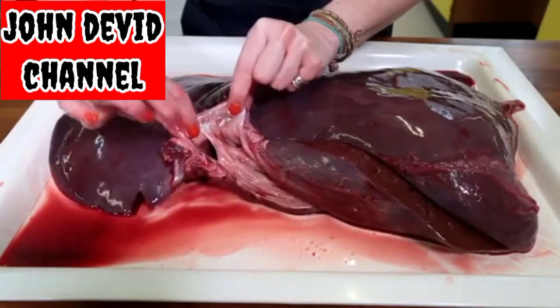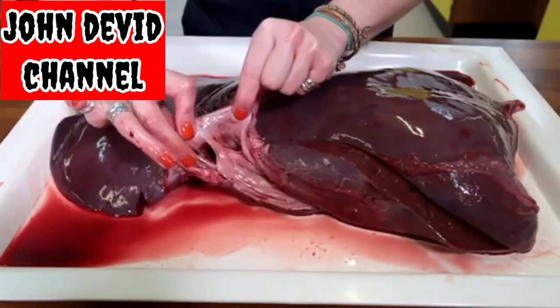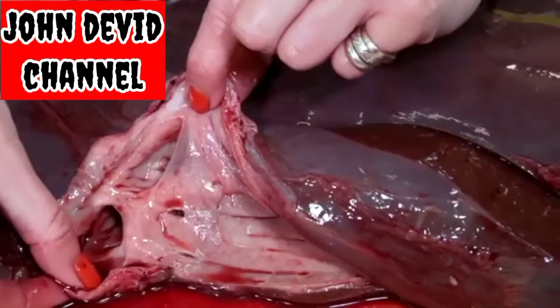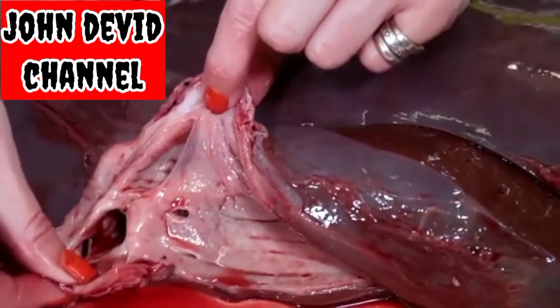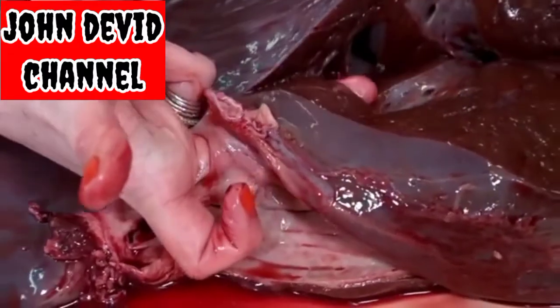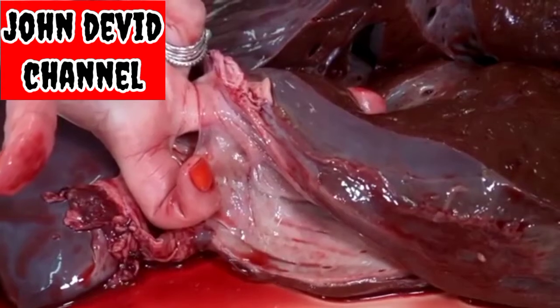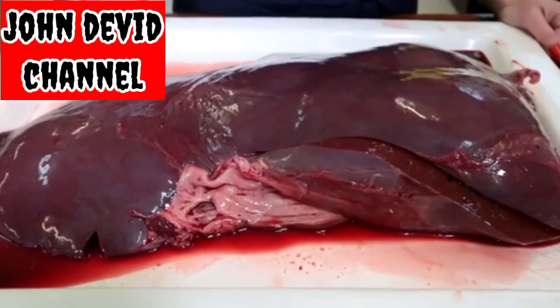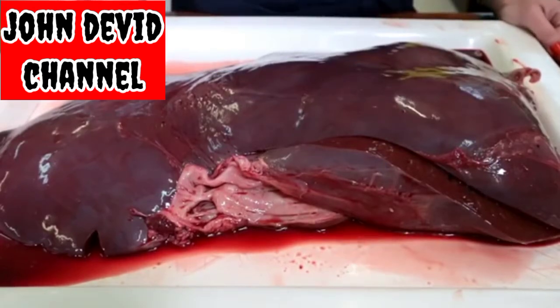This is the top of the liver, and we can see the opening of the hepatic artery and the portal vein. The hepatic artery and portal vein provide the blood supply into the main lobe of the liver and branch out throughout the tissue. So one of the functions of the liver is to produce bile, and bile is used in digestion to emulsify lipids.